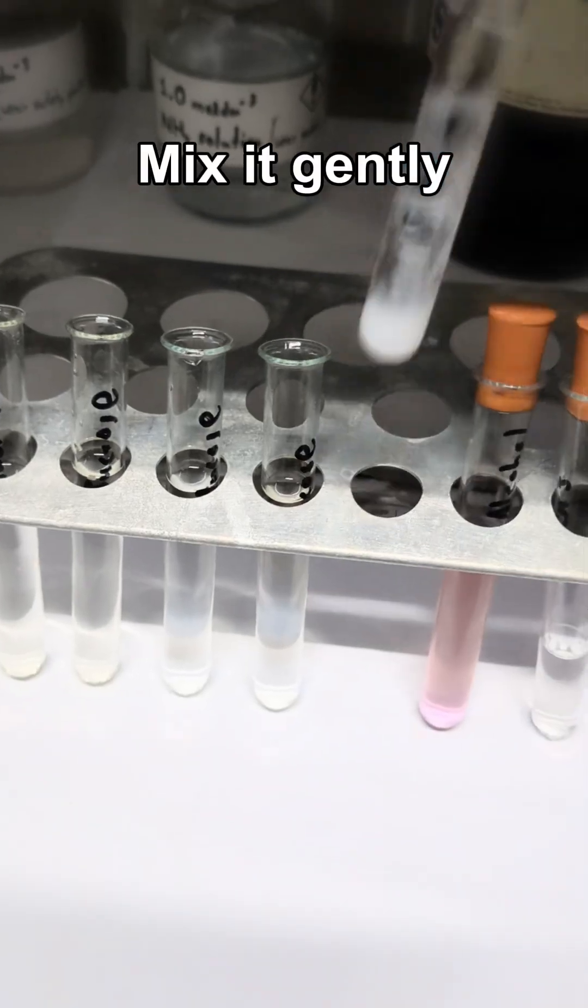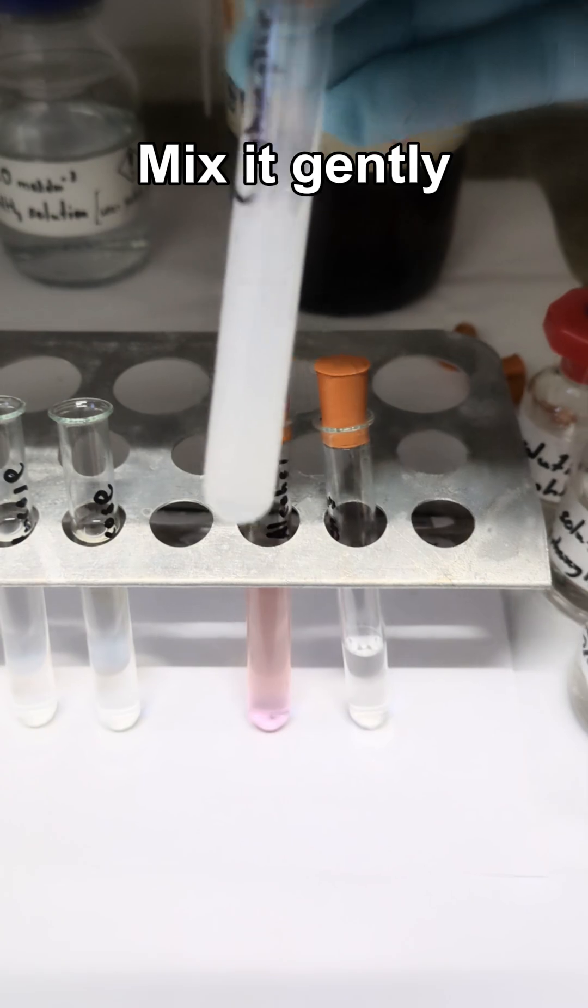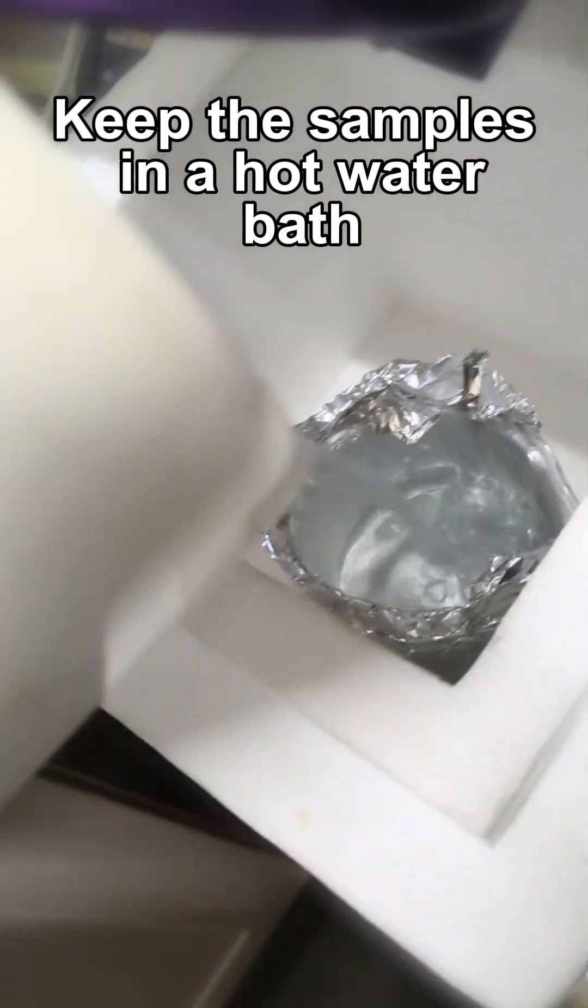Tollens reagent to the samples. Mix it gently. Keep the samples in a hot water bath.